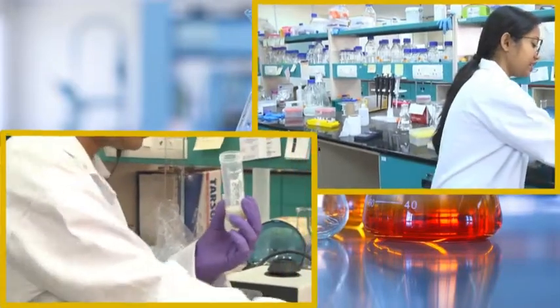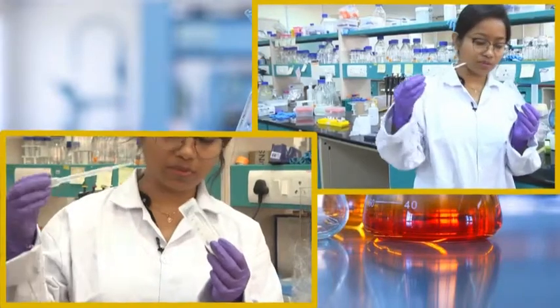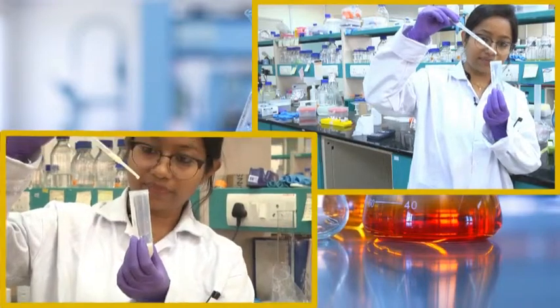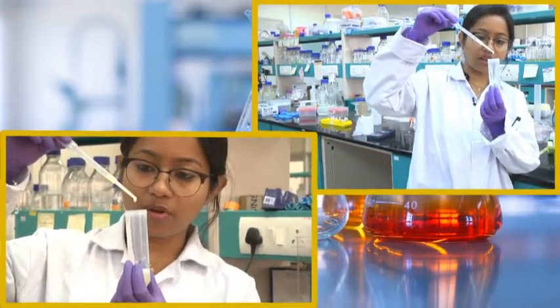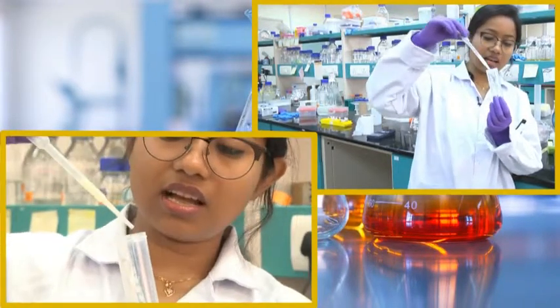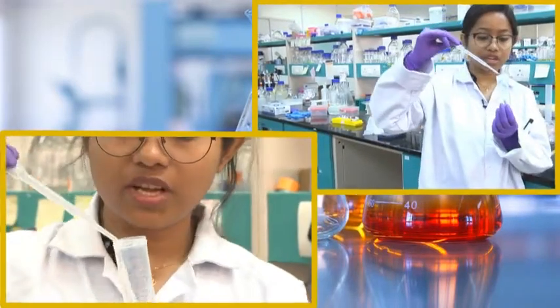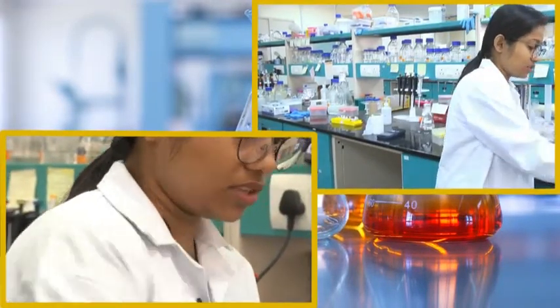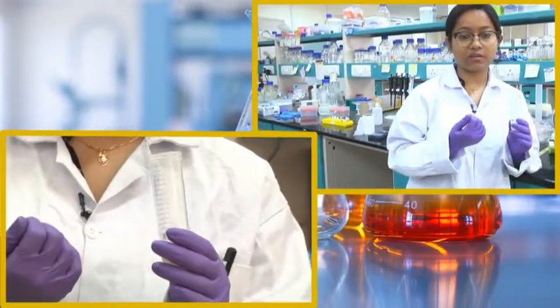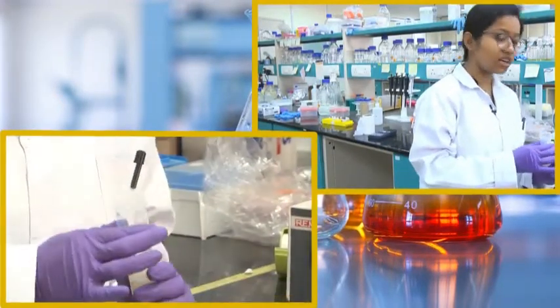Looking at the solution using a Pasteur pipette, the solution is quite runny — it forms proper drops and is not viscous. This means the cells are not yet lysed. To help with lysing the cells, the cell membrane and cell walls of the bacteria need to be lysed. For that we will use lysozyme, an enzyme which will hydrolyze the polysaccharide membrane of the bacteria, and then all the cellular components will come out.